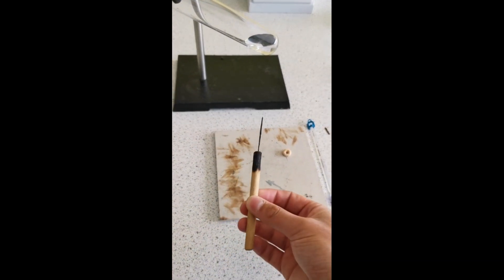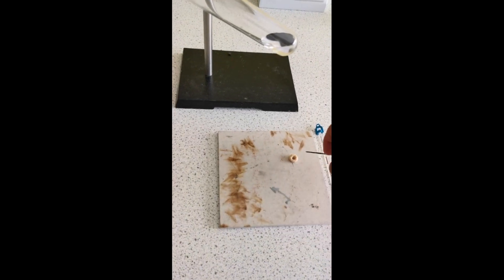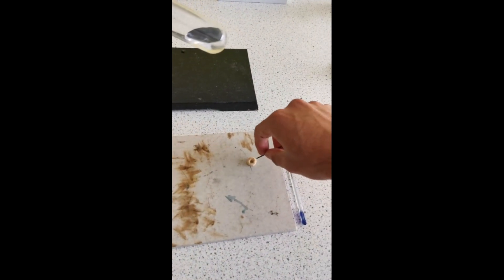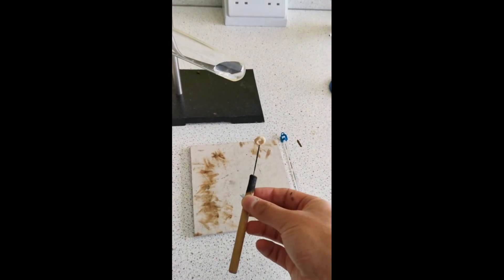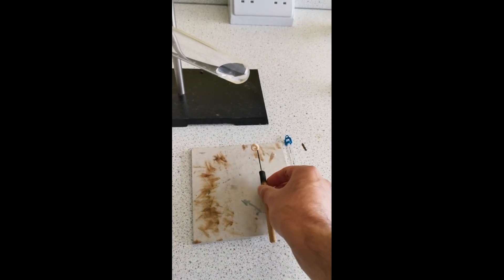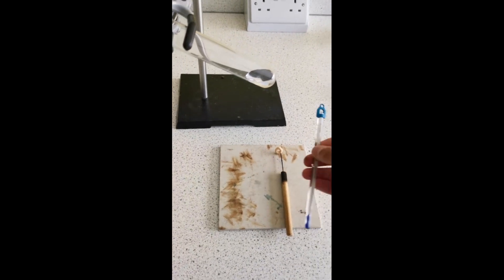This is the mounting needle. This is what you're going to be attaching the food to. I'm going to try and push it through this Cheerio. There we go, just like that.